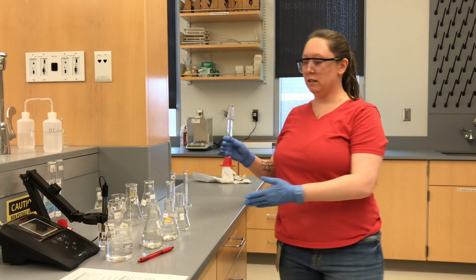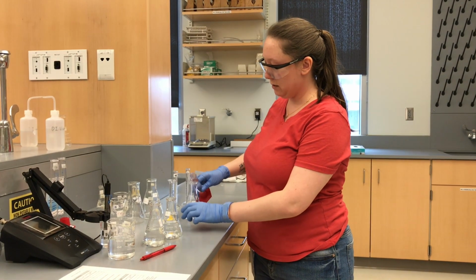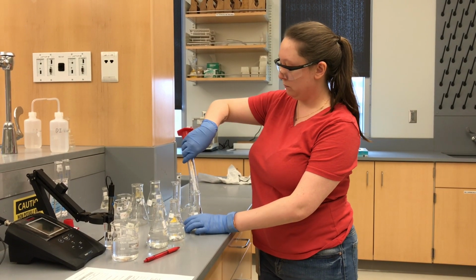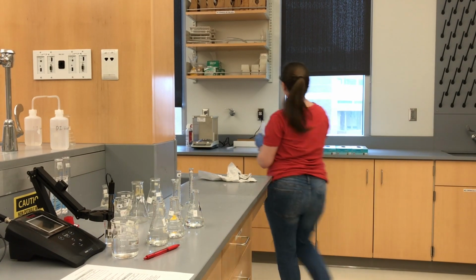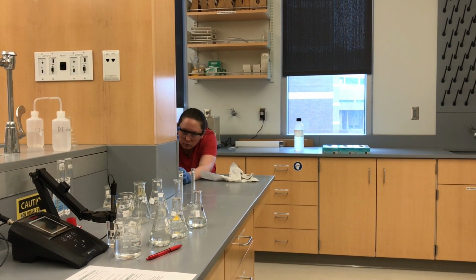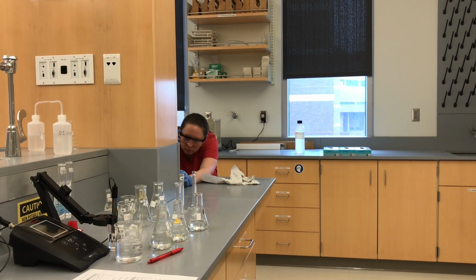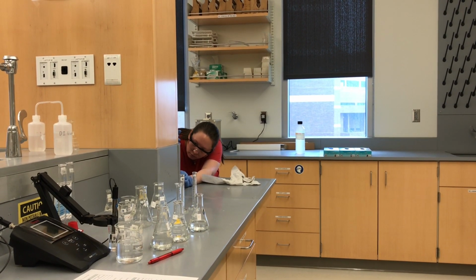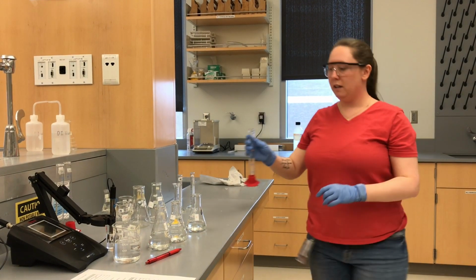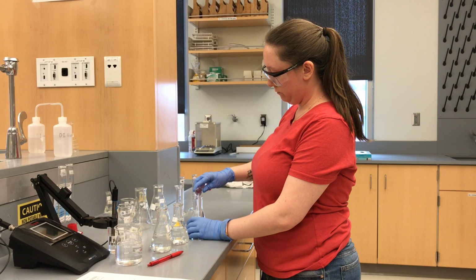So now I'm adding the 90 mils of water to this. So here's 50. And 40.